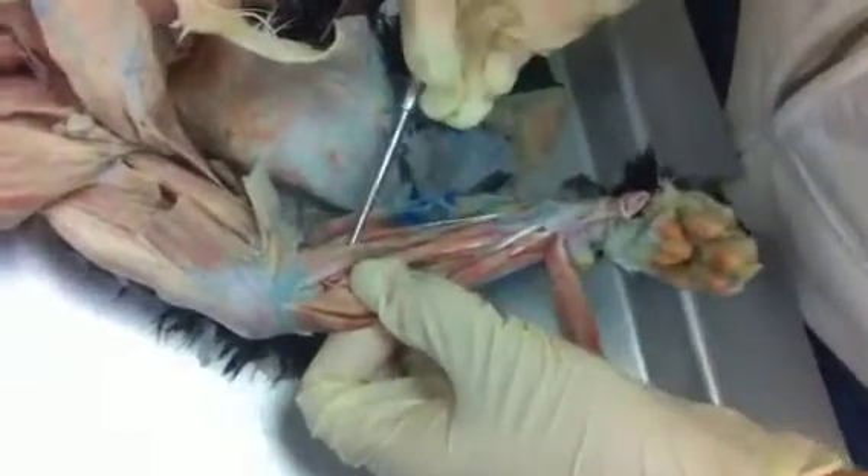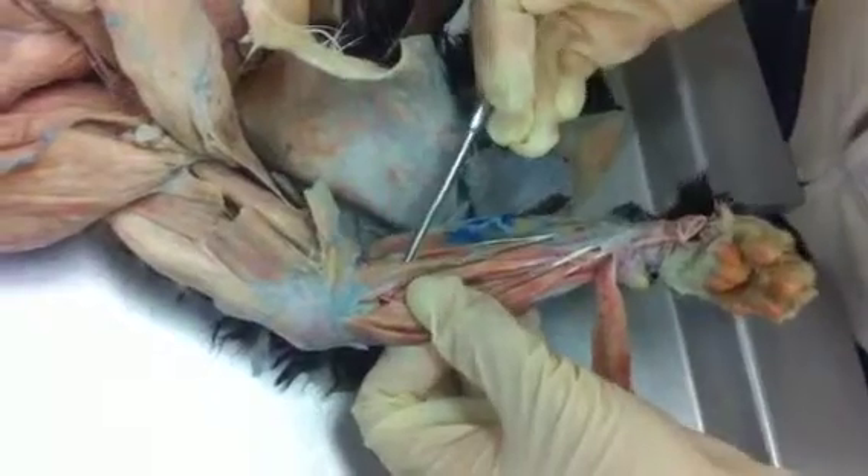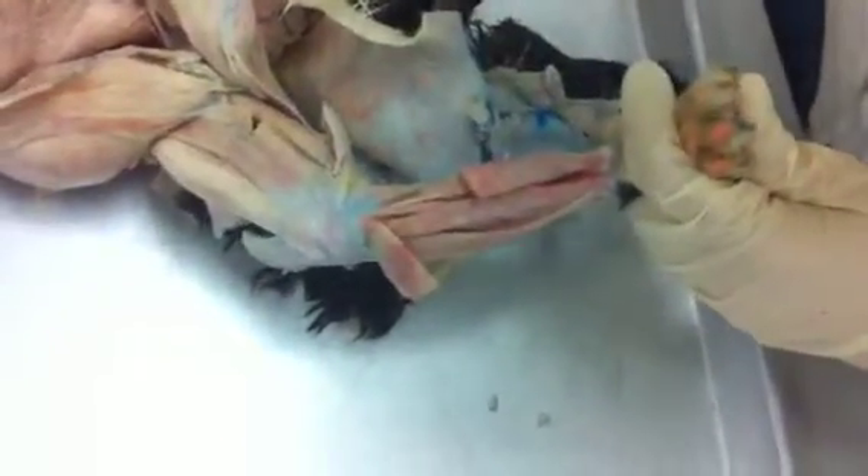Again, we are currently assuming that this is a pronator teres, but we're not entirely sure. To demonstrate, we can take our flexors together — when we flex them, they're loose, and when we extend them, they become extended and stiffer.